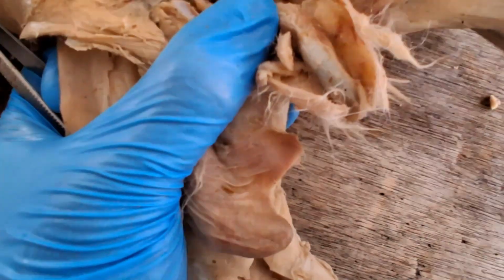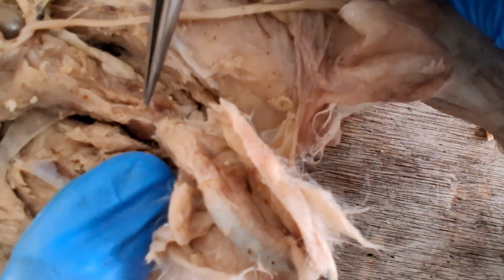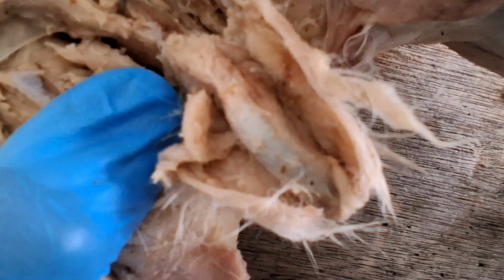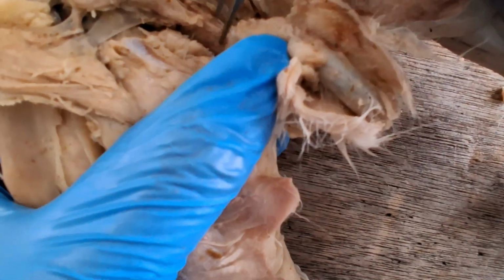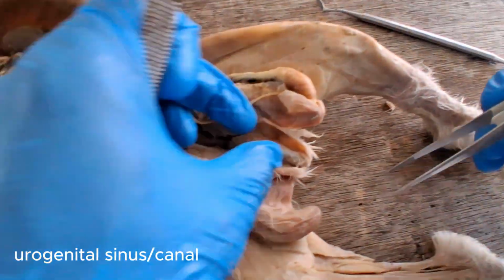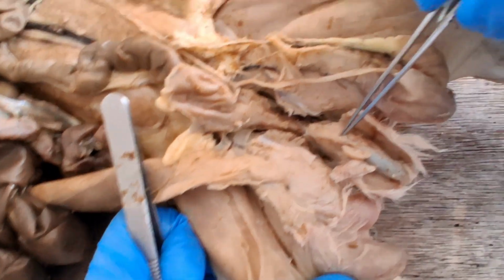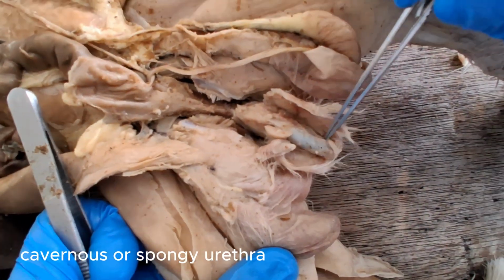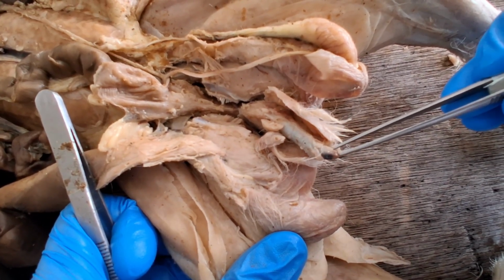And then from there, the urethra will combine with the sperm ducts to form the urogenital sinus. The urogenital sinus penetrates inside the penis as the cavernous urethra, also called the spongy urethra. And then there's a common opening for the sperm and urine at the tip of the glans penis.